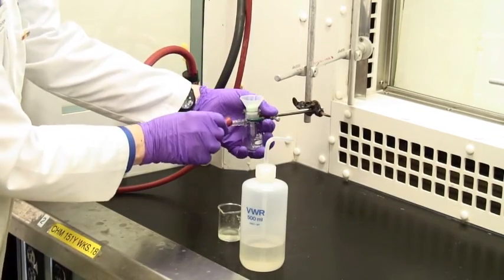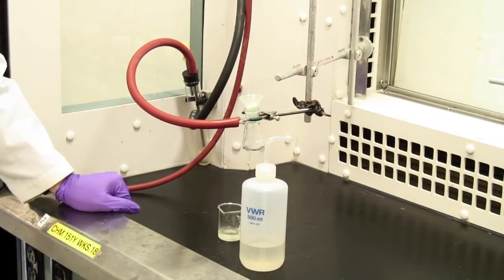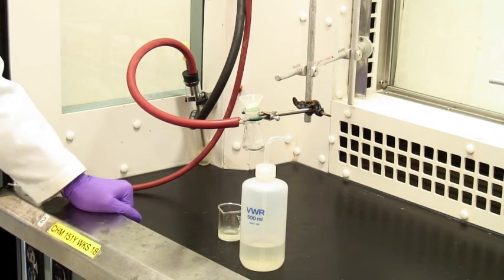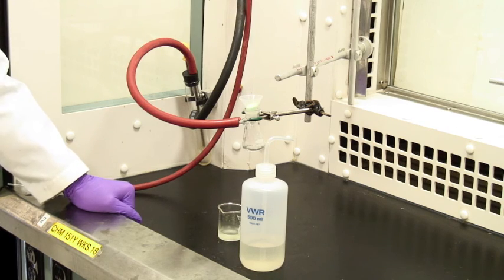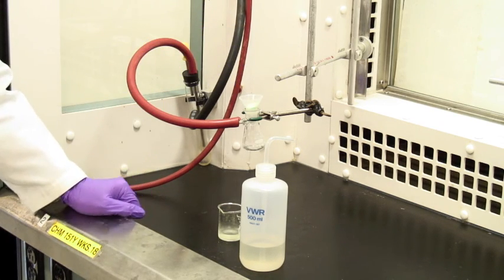Just let it sit and apply suction to it for a while. This is called drying at the pump. By drawing air through the solid, you will be drying it off. Five minutes at most will be plenty for this.